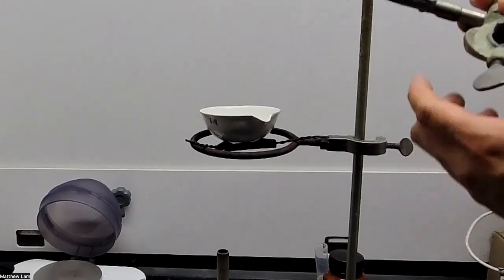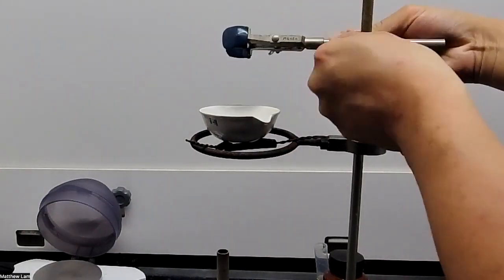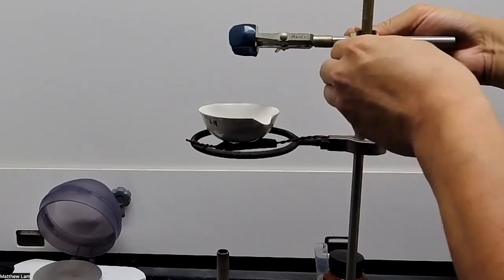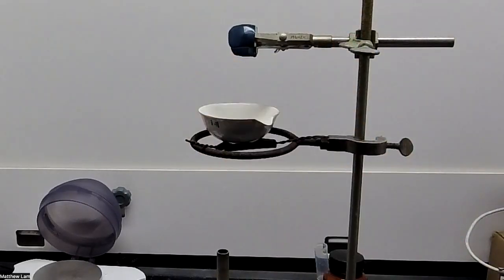So as you can see, I'm going to add a clamp that I didn't initially mention, so I can hold the funnel in place and it'll keep it from falling down later on. So that is our apparatus.